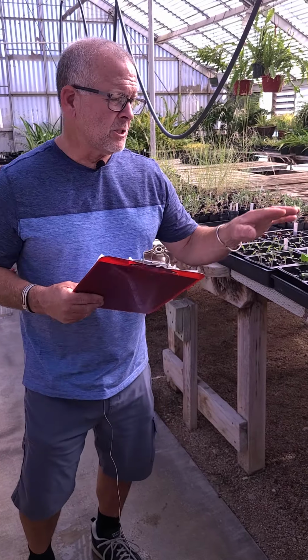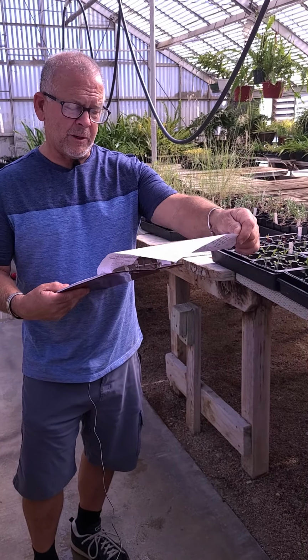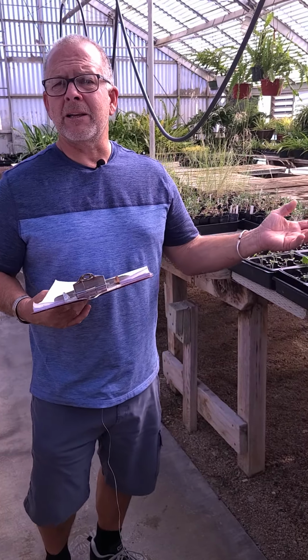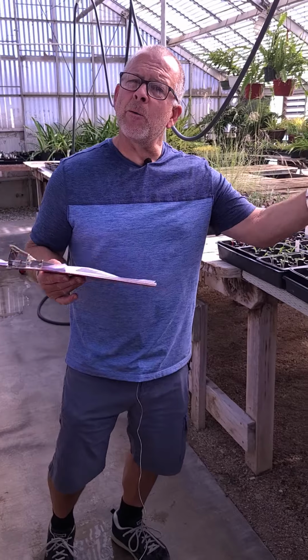So we already talked a little bit before about the drainage part of this. What we're doing in this part, the second part, is the effect of salinity on plant growth. So what we're trying to simulate here is what happens when you have poor drainage, perhaps, or you already have soil salinity issues in your soil naturally. So how will plants grow?